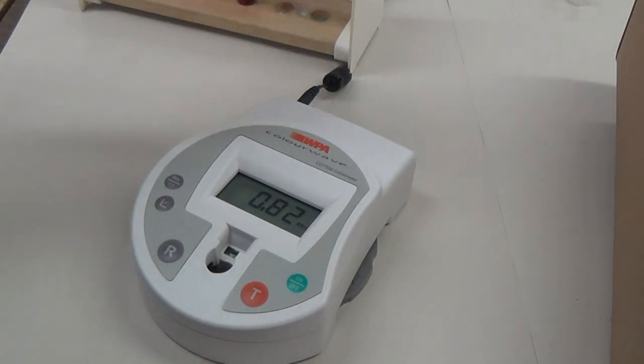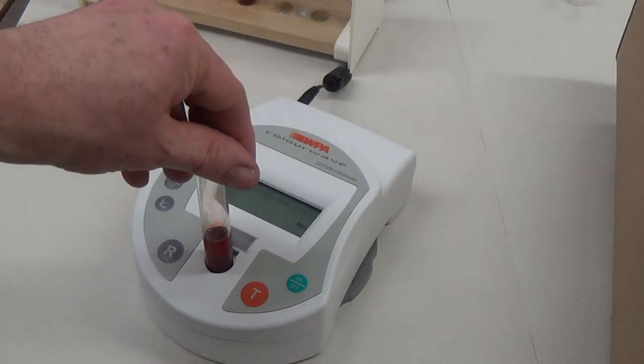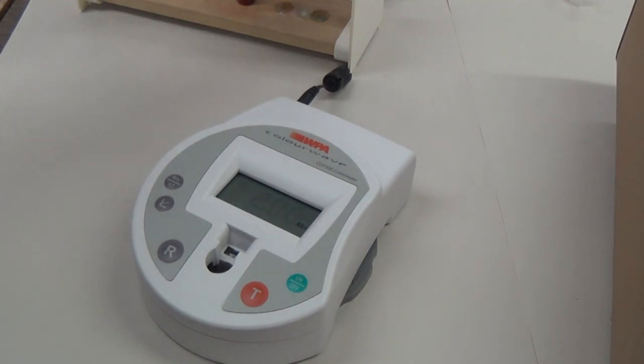And then the final one. That is 2.00, so that's as far as it will go. You can plot that on a graph.